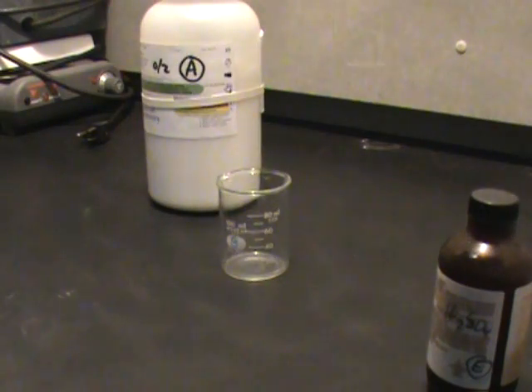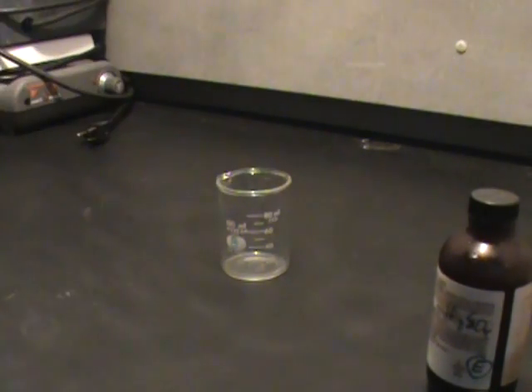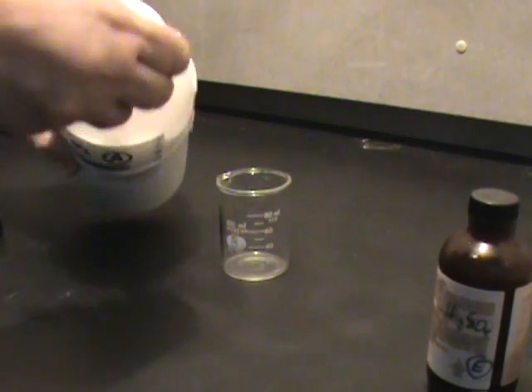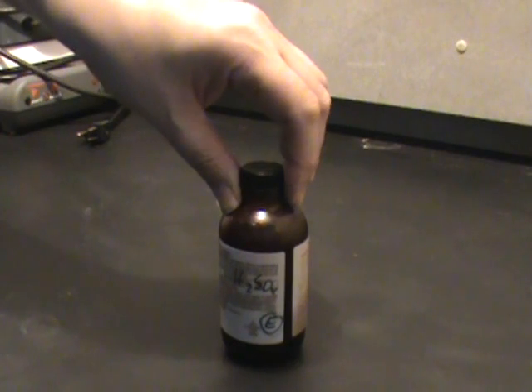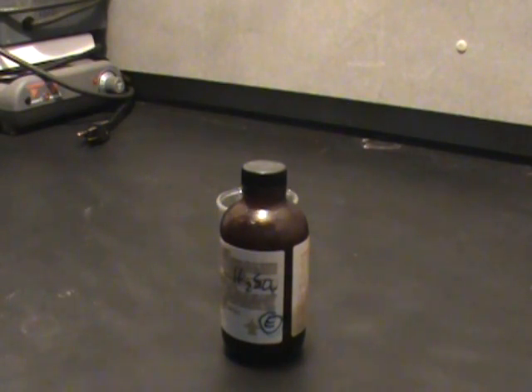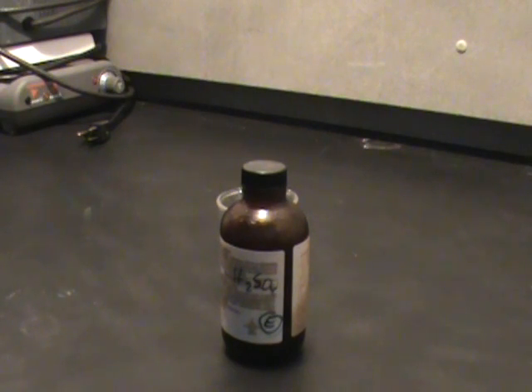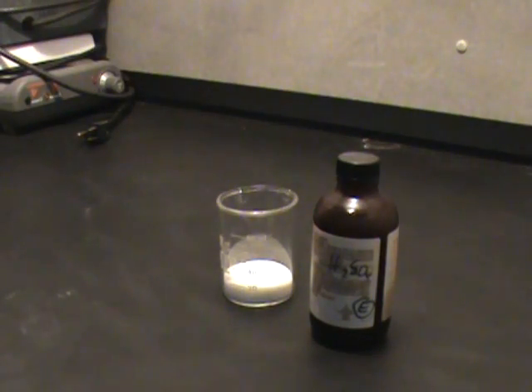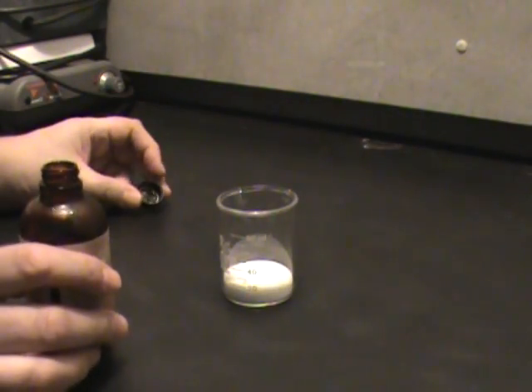To demonstrate how slow covalent reactions take place compared to what you just saw, I'm going to take sucrose — also known as table sugar, C12H22O11. Three non-metals making the bond covalent. Now we're going to add to it some hydrogen sulfate, also known as concentrated sulfuric acid, H2SO4. Johnny was a chemist, Johnny is no more — what Johnny thought was H2O was H2SO4. Do not try this at home.